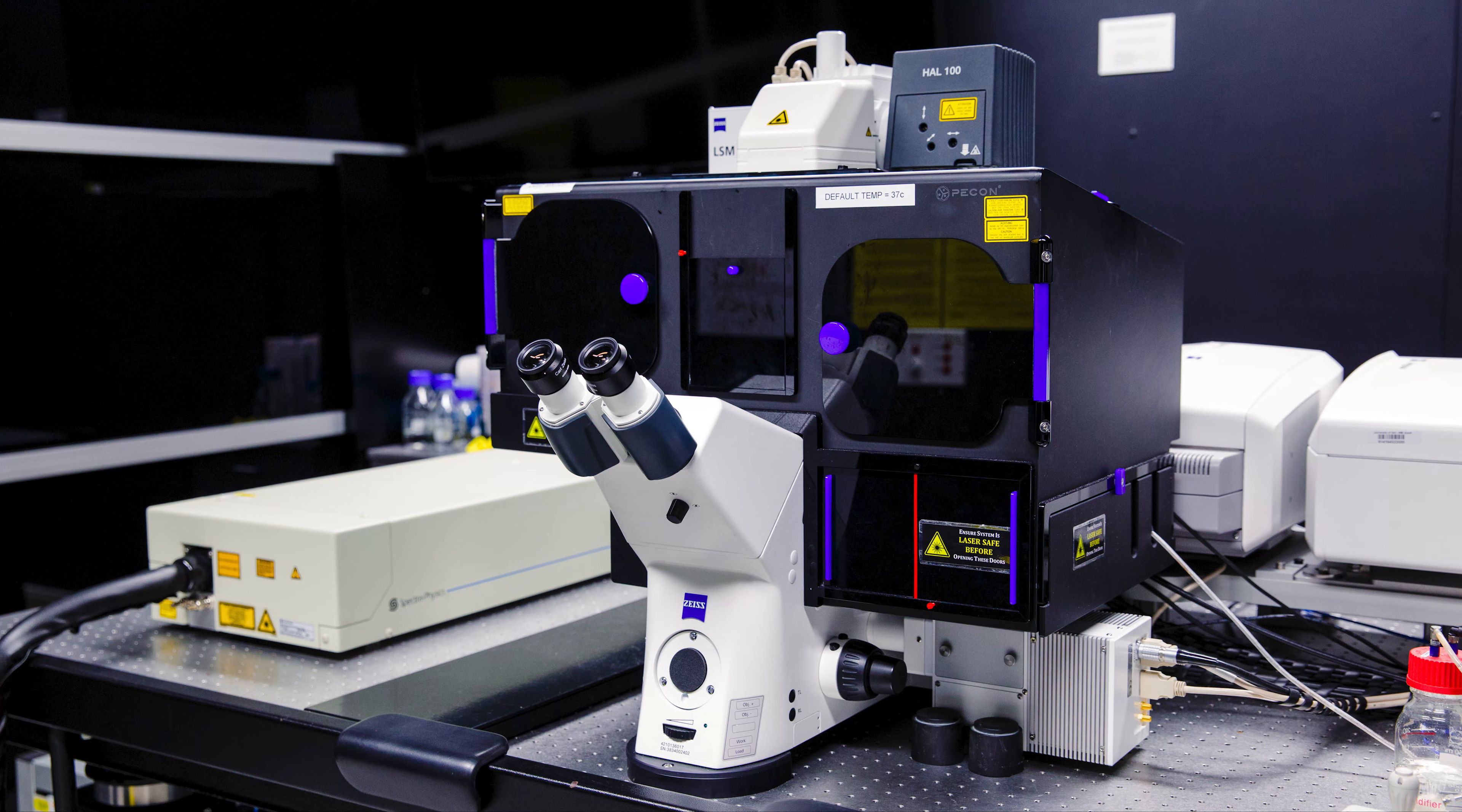These microscopes all have motorized filter turrets for either directing fluorescence light to your samples, to the eyepieces for viewing and finding them, or directing light to the confocal scan head via the relevant ports. You should not use any buttons on the microscope stands to change filters. Instead, use the buttons within the software or the small touch screen. This is for safety reasons and is not optional.